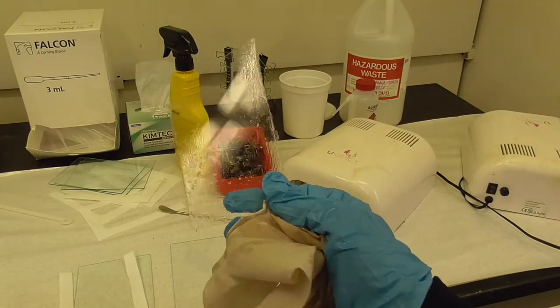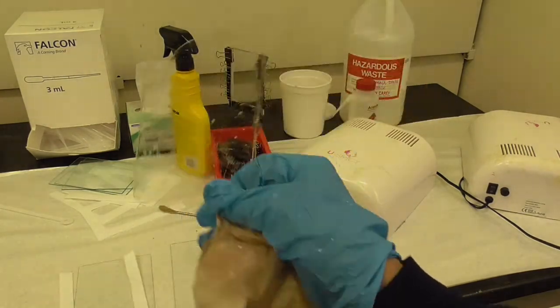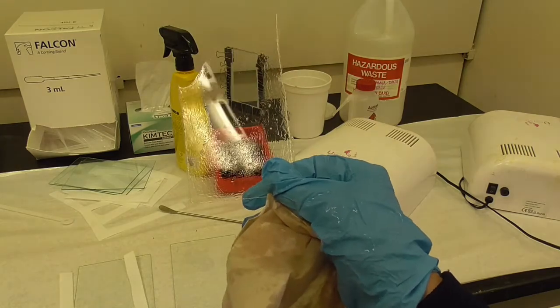So I've washed this with soap and water and now I'm ready to cut dog bones and see what the tensile strength is.